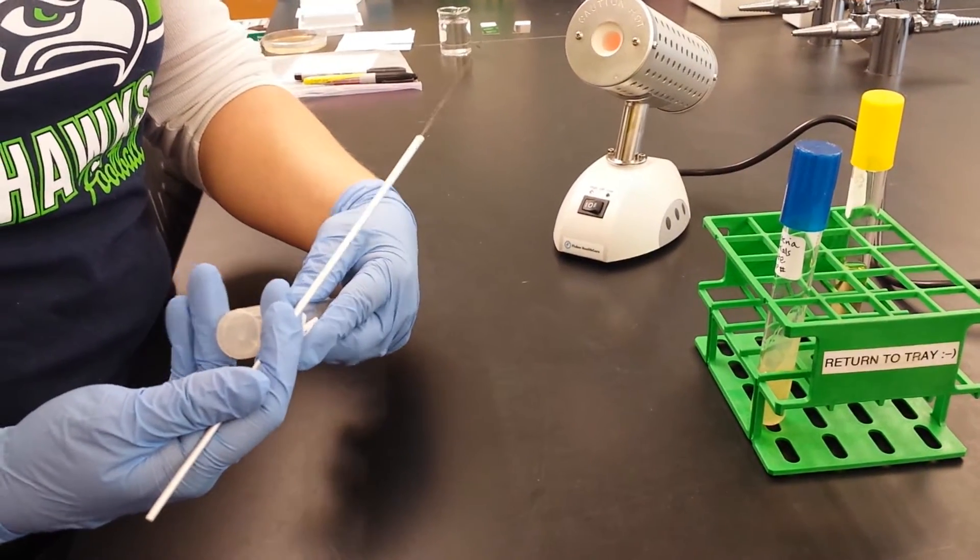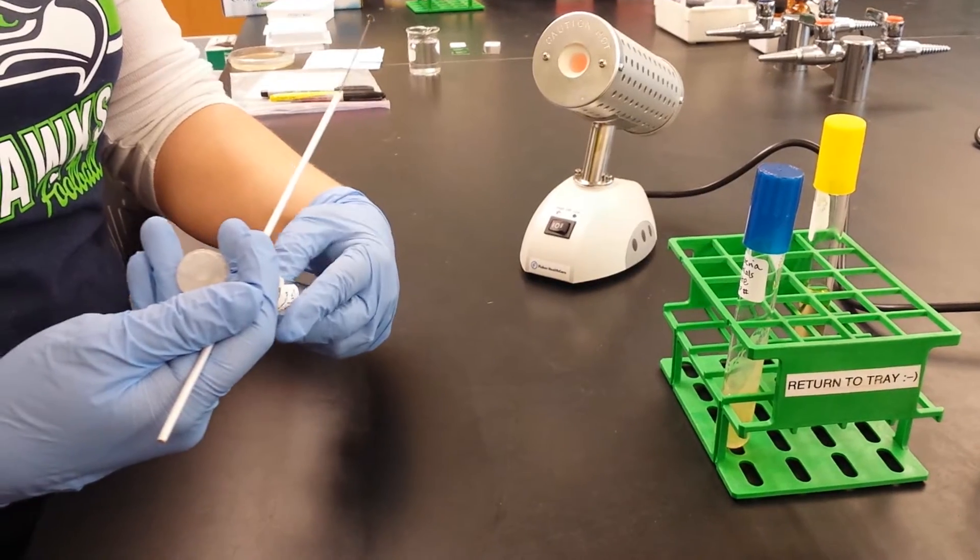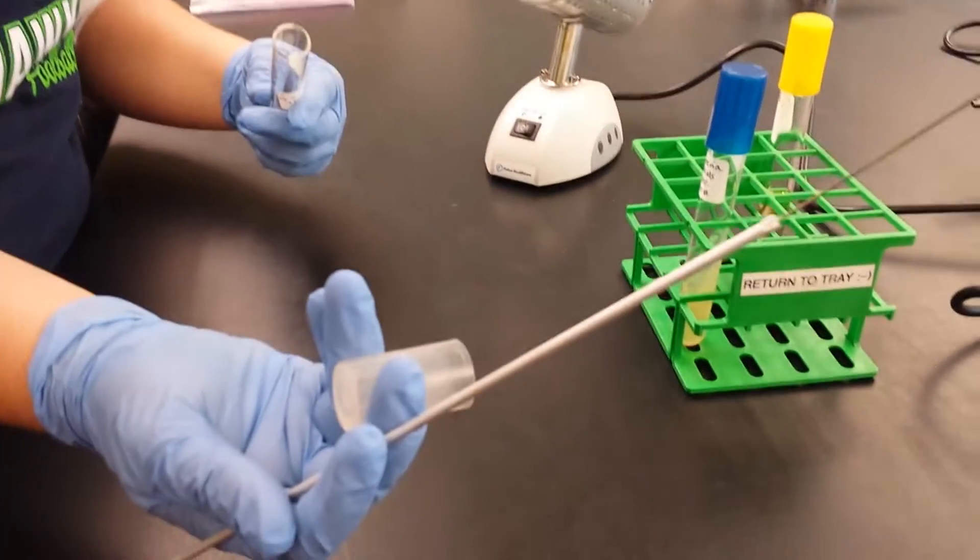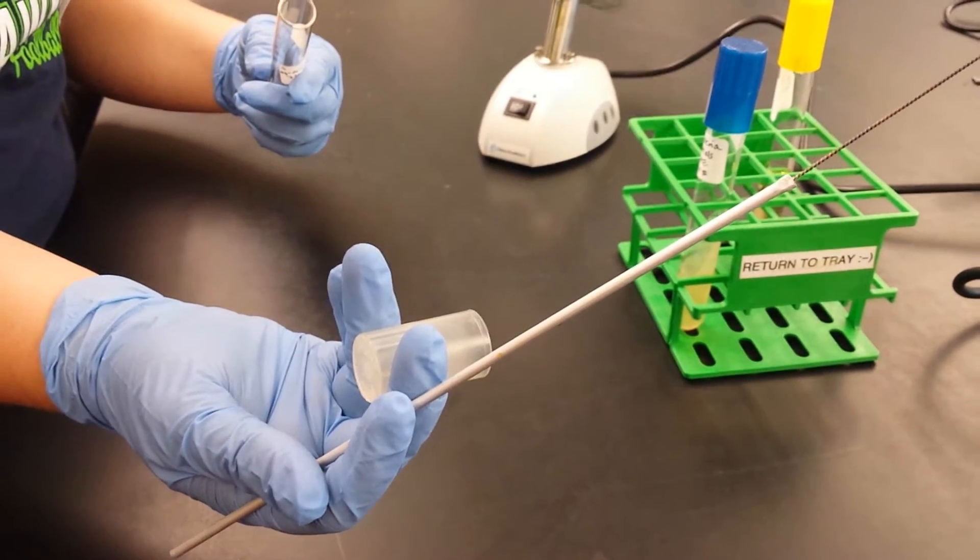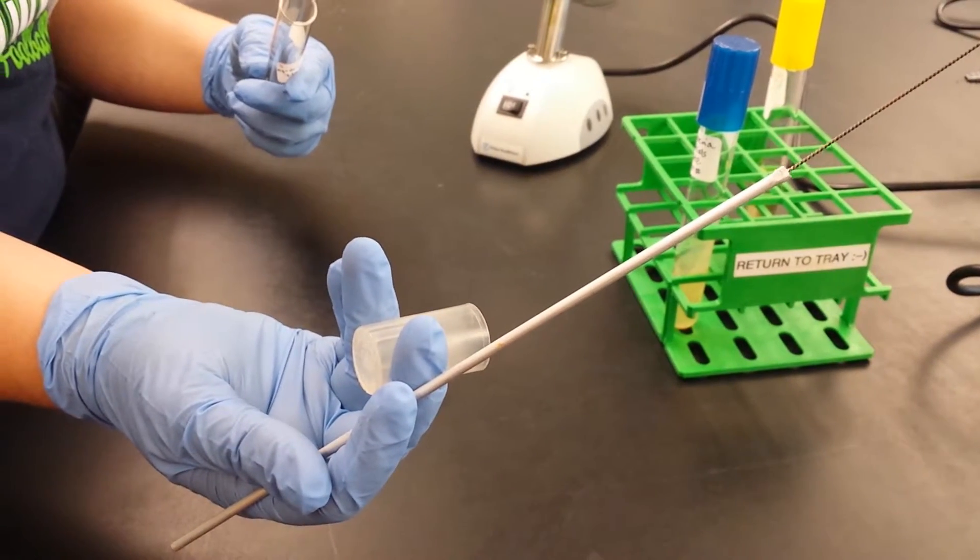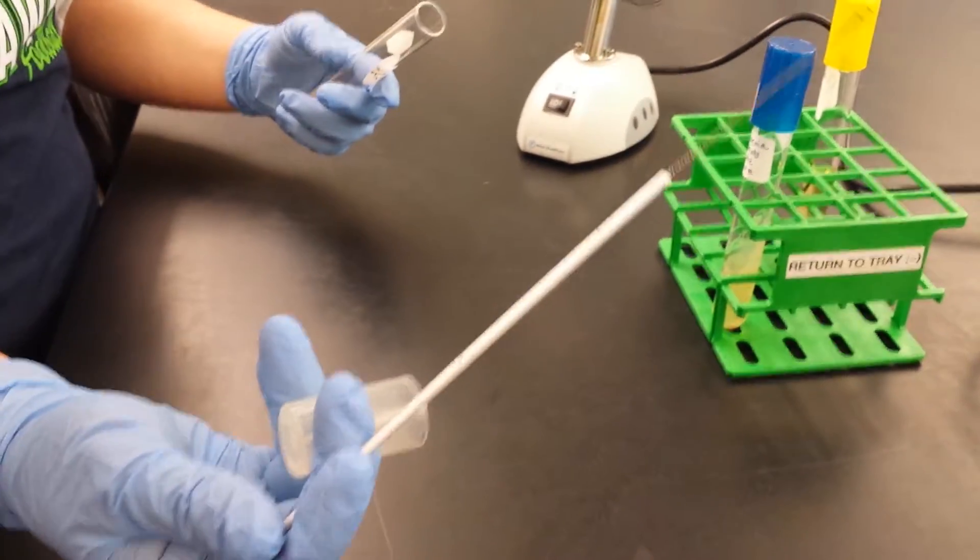Then you remove the cap with your fingers, and I want to show you something here. Do you see how my fingers are not below the grooves on the lid? And that's to make sure that I don't accidentally get my fingers down and touch the test tube itself. Okay, so I've talked long enough. This is cool.